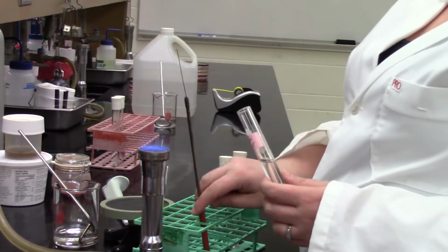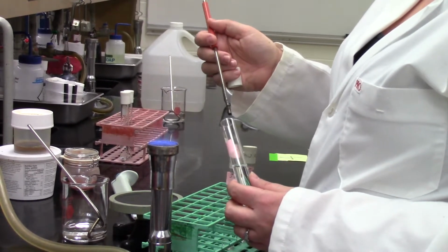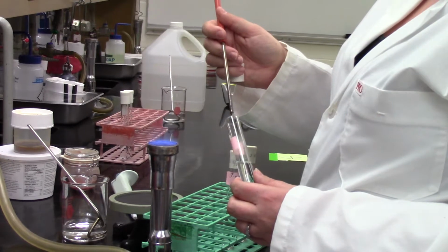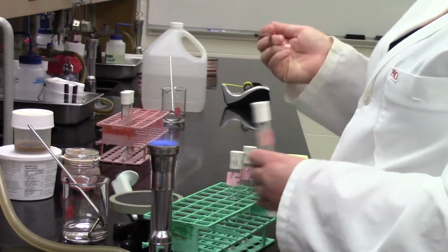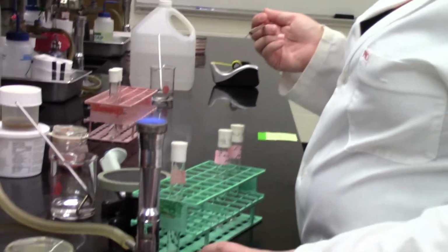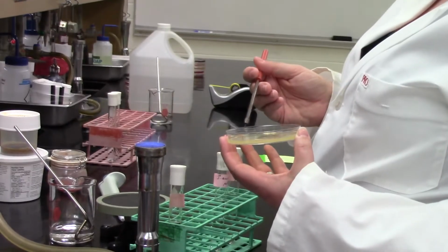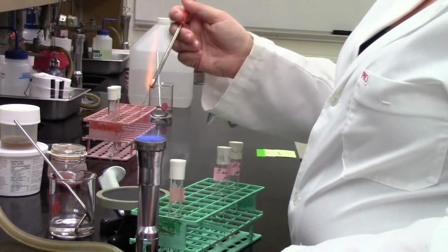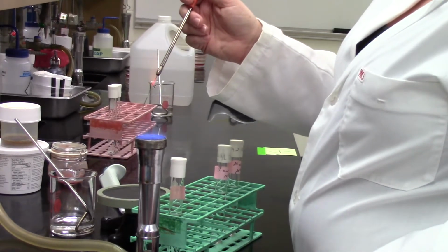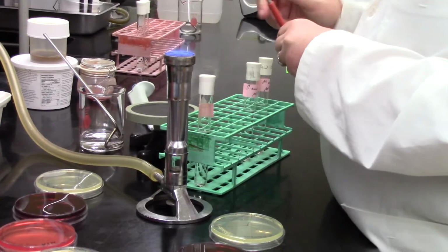The last media type you do, and you would always do this in an experiment, is a supportive media type. So this is not selective and differential. It's not going to prevent the growth of any certain bacterial types. You should see a wide variety of bacteria are able to grow on it, and these 3 should all grow on it. So we should see our Staph aureus, our Staph epidermidis, and our E. coli all growing nicely on our tryptic soy agar plate that she just inoculated with the Staph epidermidis.